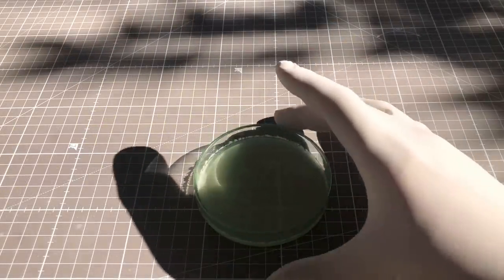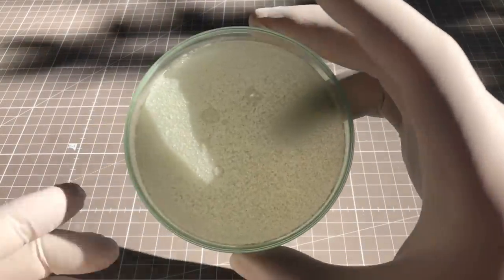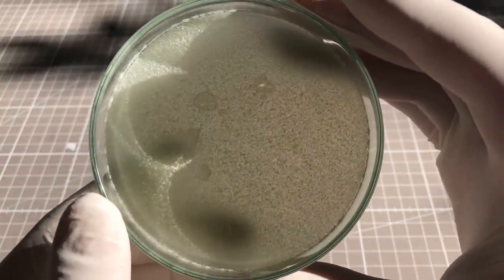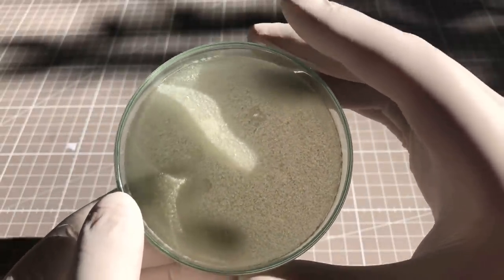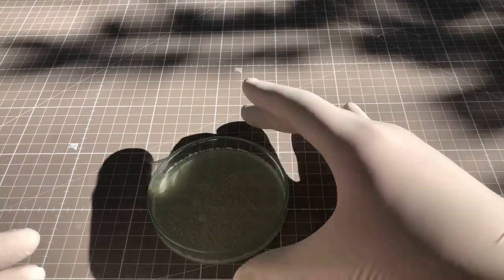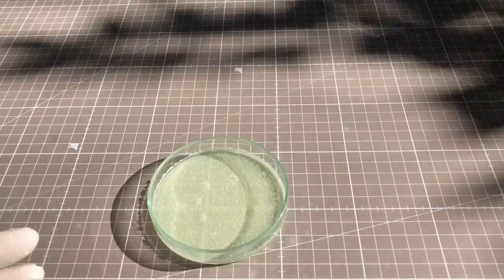After the chlorine gas generation was complete, the chlorinated benzene was placed in a petri dish for evaporation. To avoid producing more very polluting waste, I decided not to purify the lindane any further. The yield was just 3.6% compared to the theoretical one.